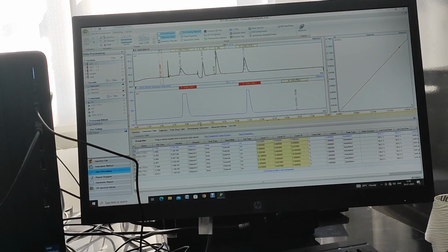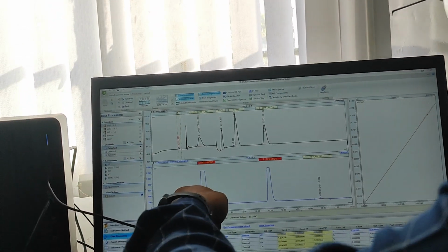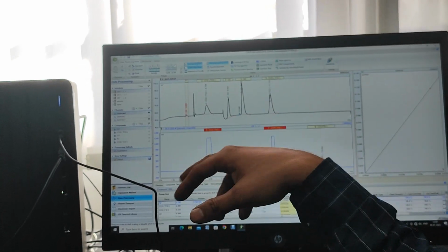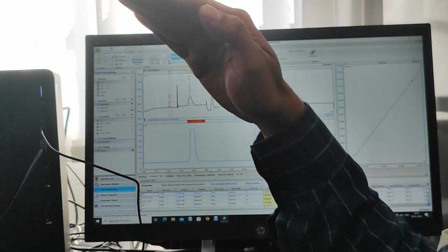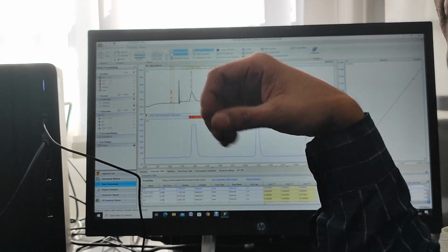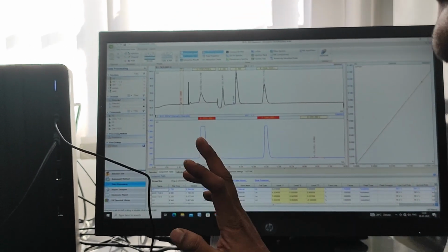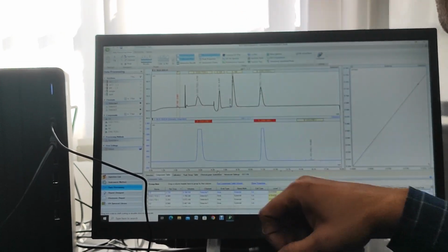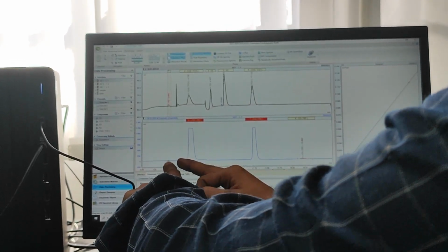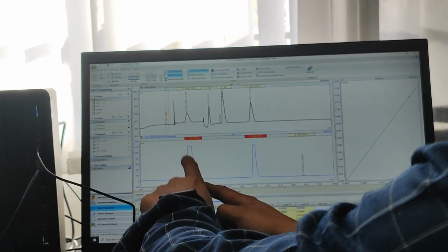See, here this peak is saturated. CO2 is saturated. It is converted into methane, and this detector is calibrated for low ppm concentration level. That's why, as it is in percentage, it gets saturated, a table-shaped peak. So you are not able to get the proper area of this peak because we don't know where it should meet. So we will delete this peak. We will take this one only. And the hydrogen peak is not coming here because hydrogen is not detected in FID, it is not a hydrocarbon. CO2 is converted into methane, now it is detected in FID.